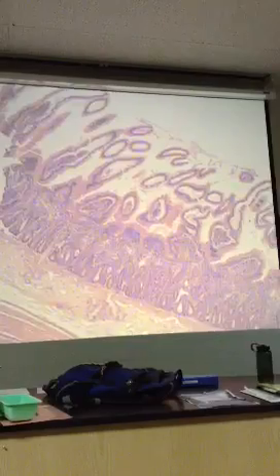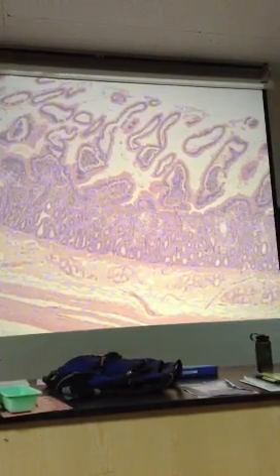All right, so let's do the main layers. From the tips of the villi all the way down to there. What's that main layer? Mucosa. Mucosa, yeah. Okay, don't fall asleep on me, guys. What's this main layer from here to here? Submucosa, good. Gotta power through the last 2 units. I know it gets a little tough.